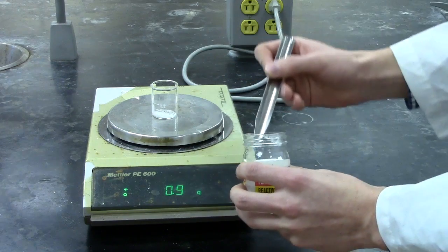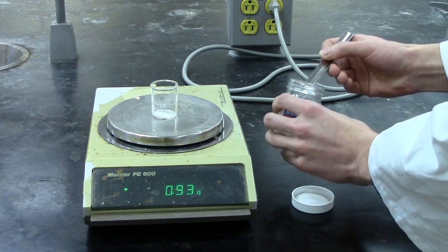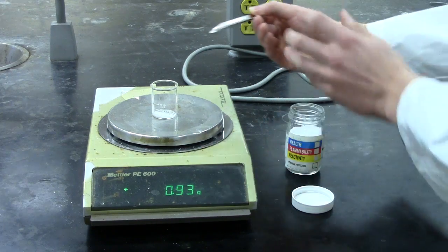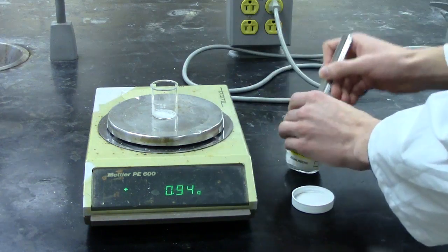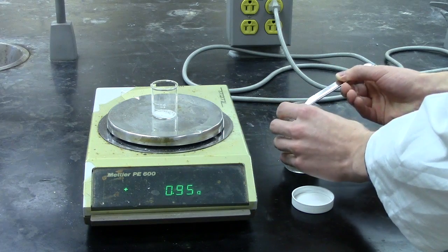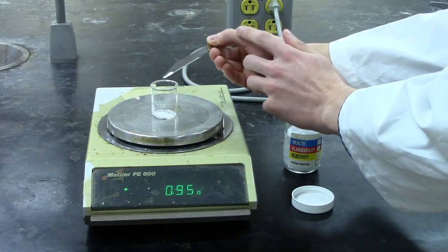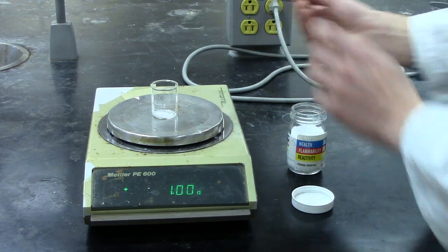You will gradually add your substance, and as you become close you can use various techniques to load smaller amounts at various rates until you reach your target point.